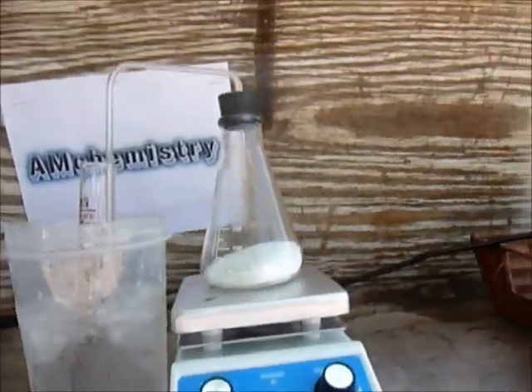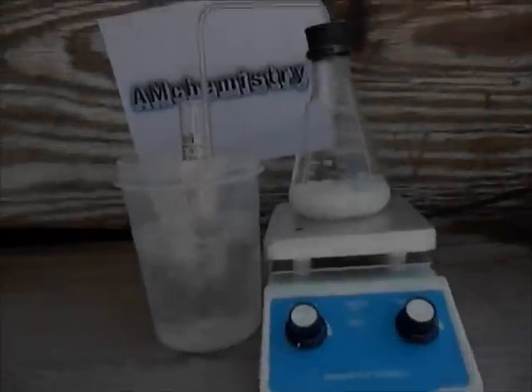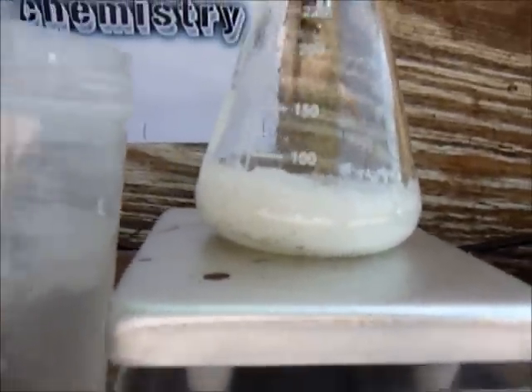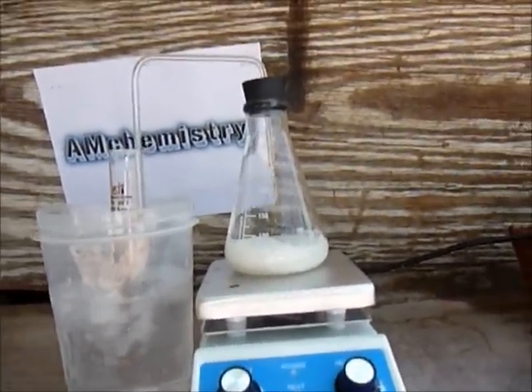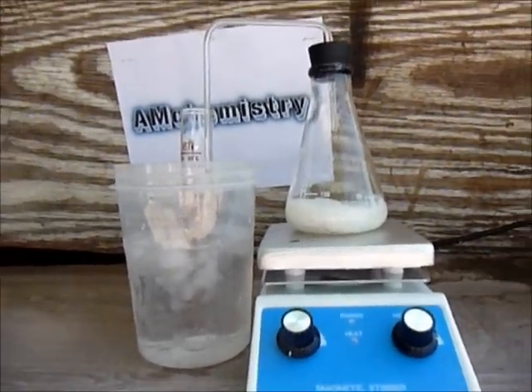So it's bubbling. I'll show you when I'm halfway done. As you can see it's bubbling a lot now. Let me just take off the water here — it's boiling a lot and look, it's boiling inside. I'll show you when I'm fully complete with the hydrogen chloride going into the water to make hydrochloric acid.